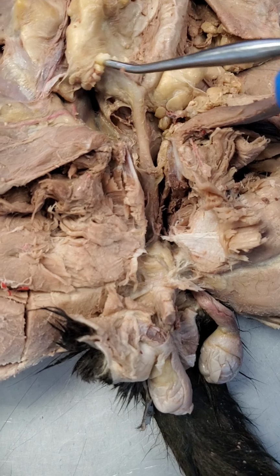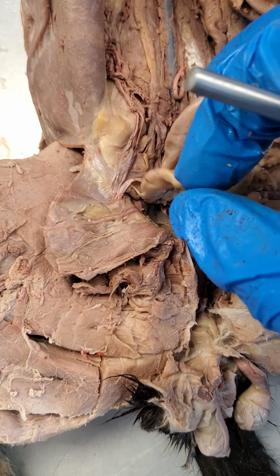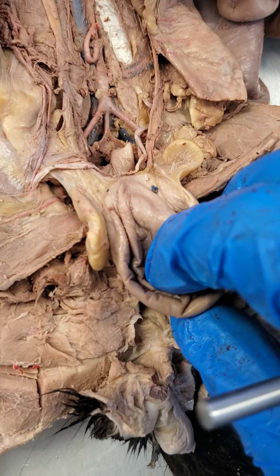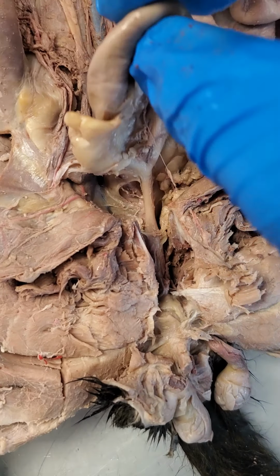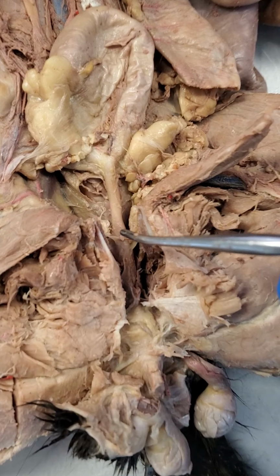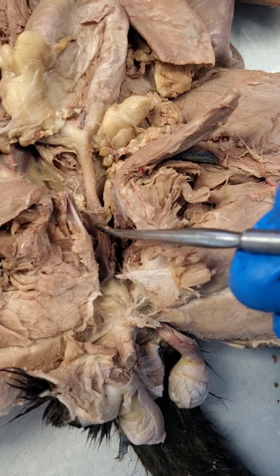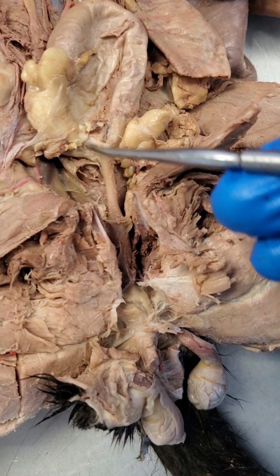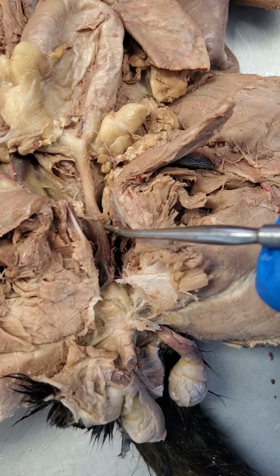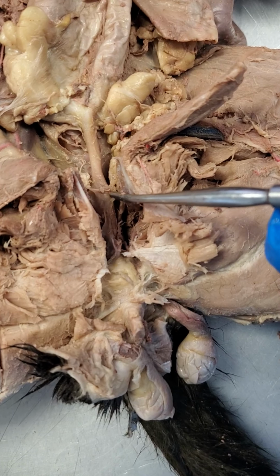And essentially what happens is we have the vas deferens, again, if I can pull this down, that's looping behind that bladder. And that vas deferens is essentially merging into the urethra right around where the prostate gland is. So this is all the urethra. And you can see right here there's a little bit of an expansion where the urethra widens. This is right where the prostate gland is. And we have that vas deferens running down, and it essentially becomes the ejaculatory duct inside of this prostate gland. So this widening is where the prostate gland is on the cat.